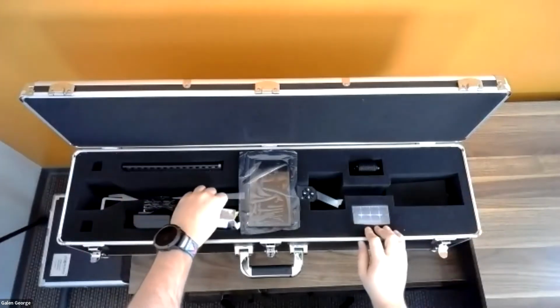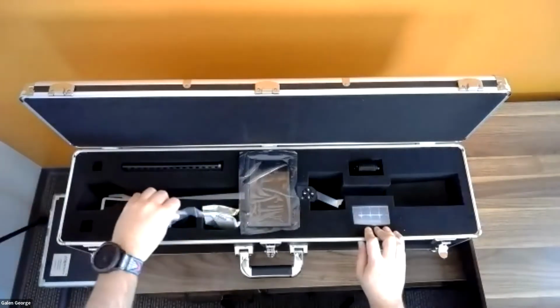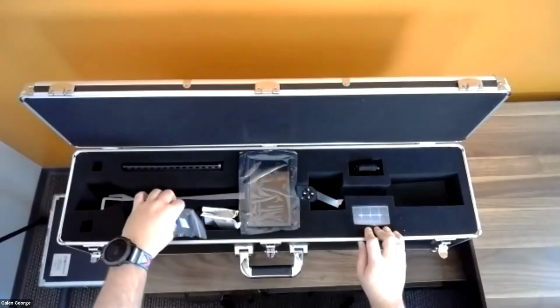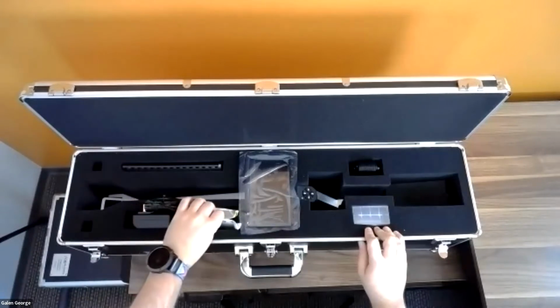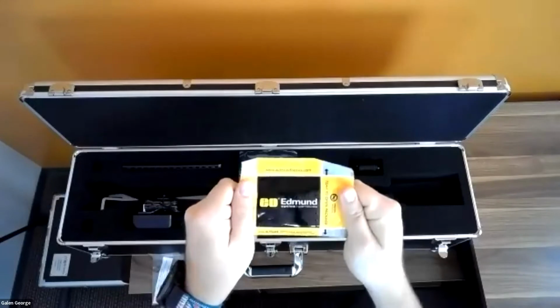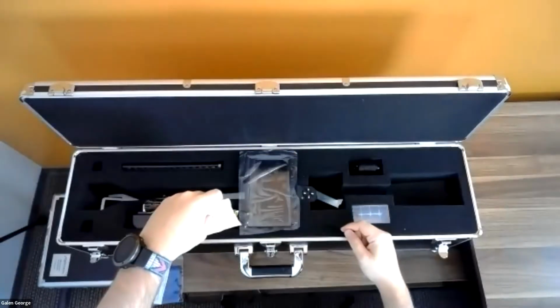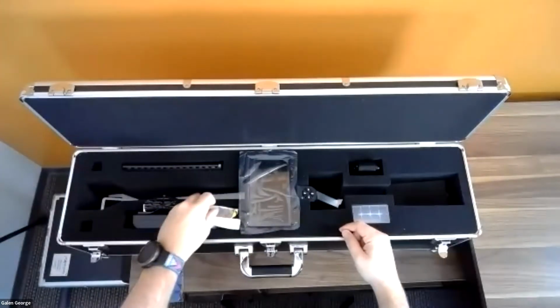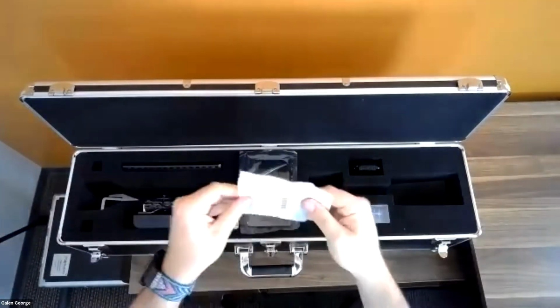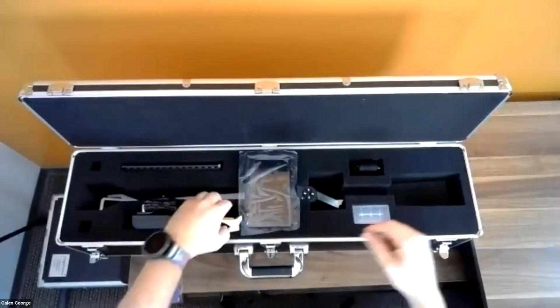those rechargeable lithium ions. In this pouch here, we've got a lens cloth that's just for cleaning off your camera and your screen. We also have here 2 neutral density filters. And this is a feature that I'll explain to you in a little bit once I pull the instrument out. But we include 2 of these at different optical densities inside of this as well.